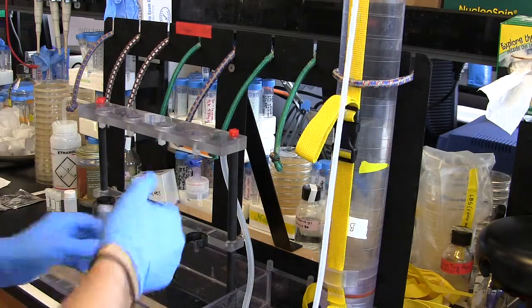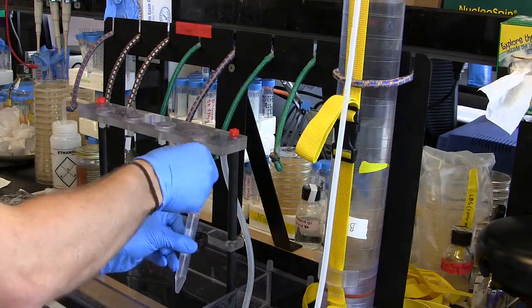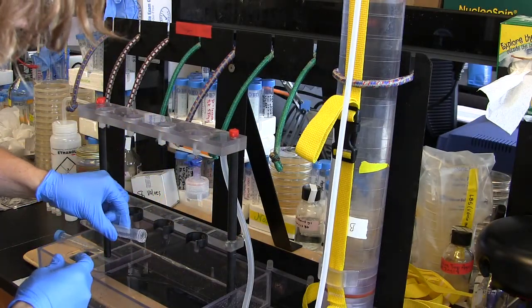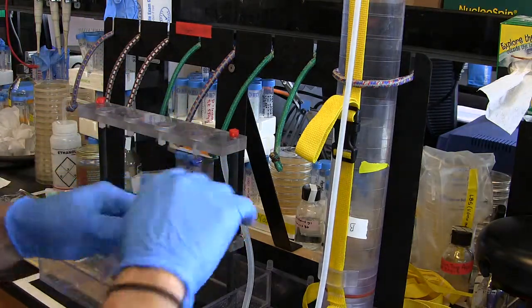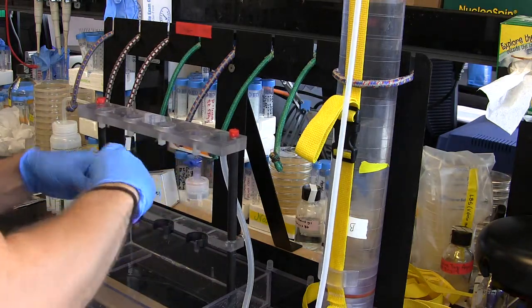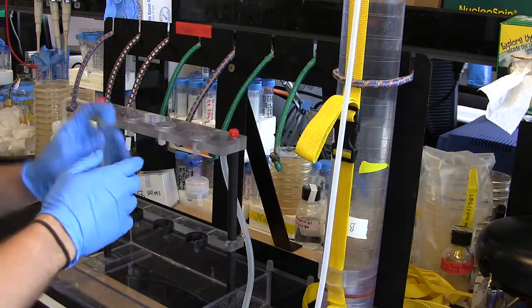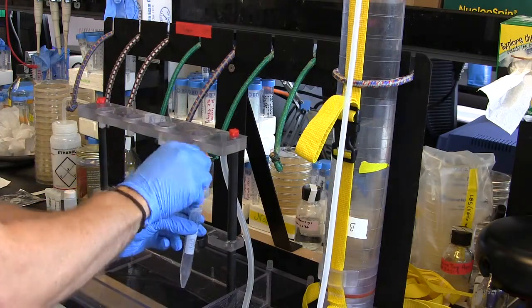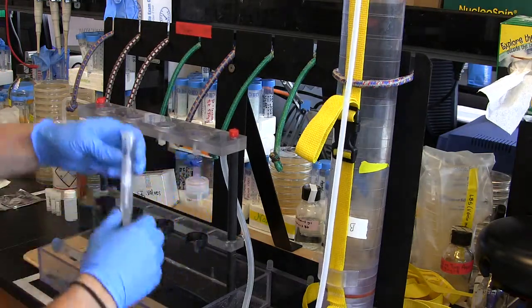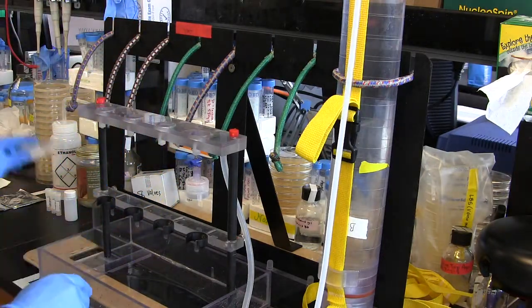Then flip it out and fill to 2 mils. You don't want to go through too much volume just on rinsing because later on you'll start to notice all that lost volume — just a couple of mills to rinse it out. Two mils exactly — do that for each tube. Set those aside for slide making, which involves fixation, staining, and that kind of stuff.